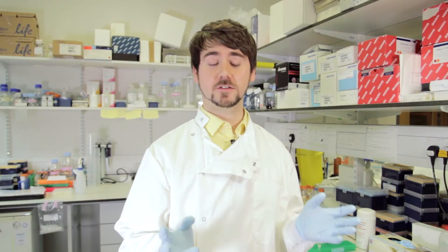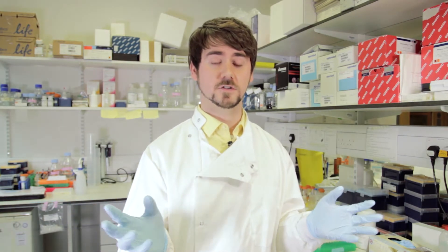Before we begin, I'd like to give a little introduction to Sanger sequencing. Sanger sequencing was invented in 1977 by Frederick Sanger in Cambridge, UK, and it has become the gold standard for sequencing. The reason for that is because it's cost-effective and very easy to perform. It has since been superseded by techniques such as next generation sequencing, but those are far more expensive and the scales of the experiment are larger. So for today we're going to focus on Sanger sequencing.